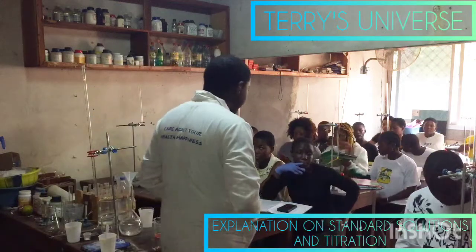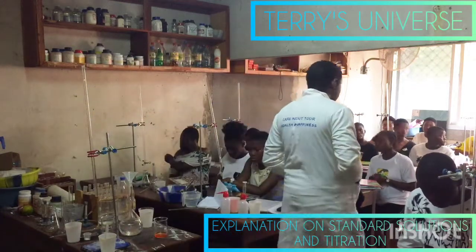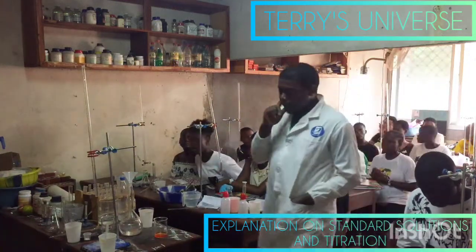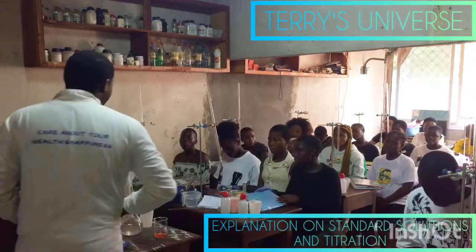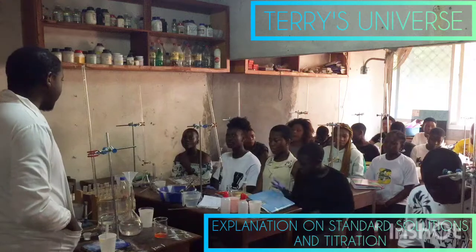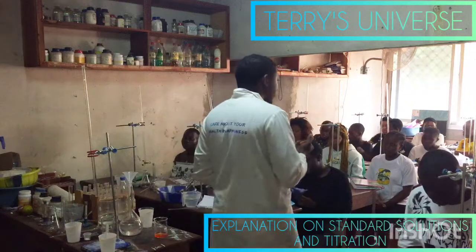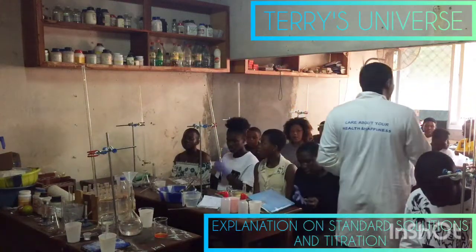What is the standard solution? So we are going to carry out the standard solution, and then we use that to carry out the simple titration solution. Now what are the basic steps in carrying out the standard solution? What are the basic steps? What are the best things to do? Carry out any standard solution.